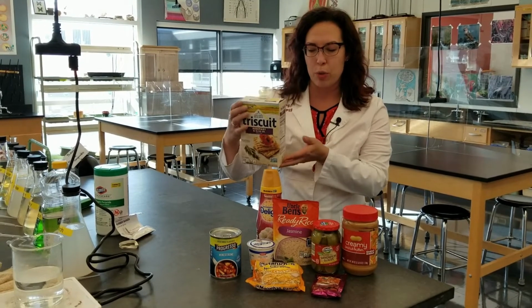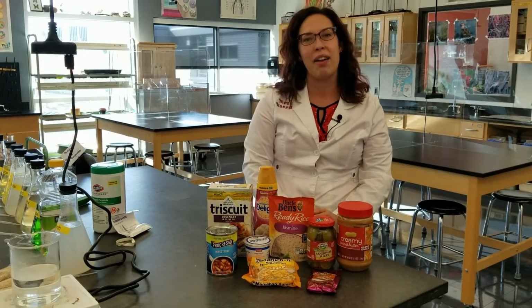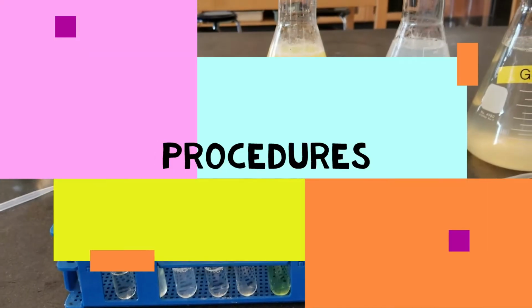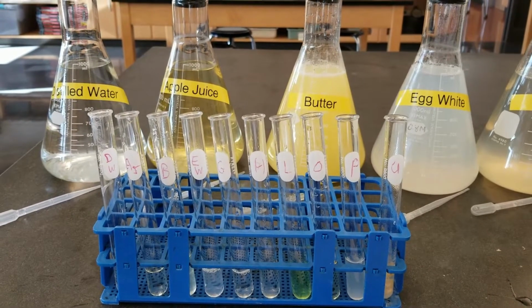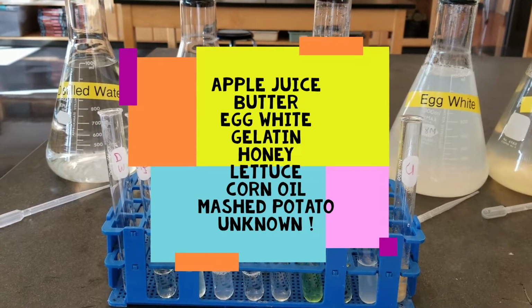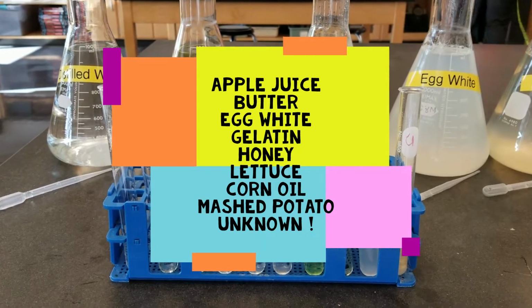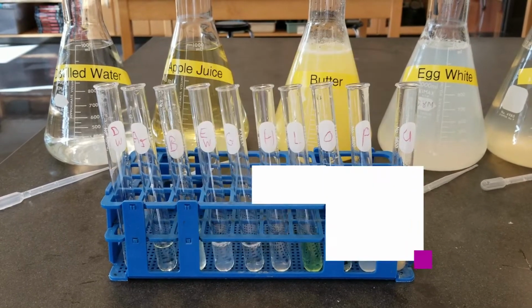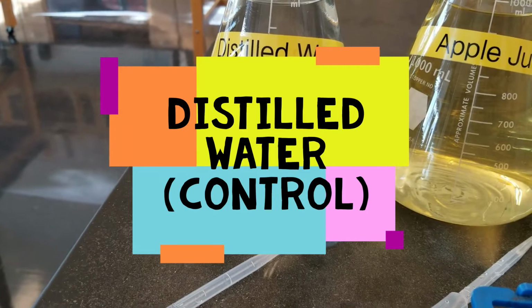We're going to teach you some simple chemical tests using indicators to assess a variety of liquefied foods. The liquefied foods that we are testing today include apple juice, butter, egg white, gelatin, honey, lettuce, corn oil, mashed potatoes, and an unknown. We're also going to use distilled water as today's control.